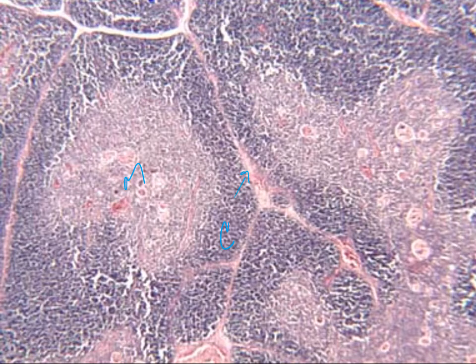It's one of the unique things about the thymus that it does degrade over time. So we do see some changes within the cortex and the medulla as they start to shrink as we age. And then the spaces of the septum are going to become much larger as we age as well. And so we can see those changes that are there.